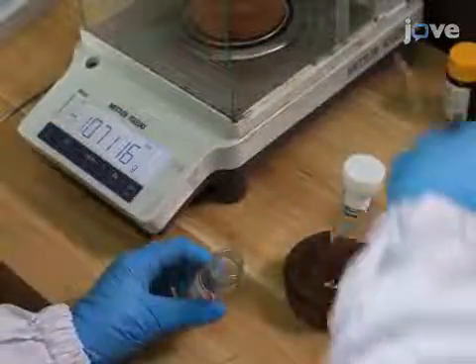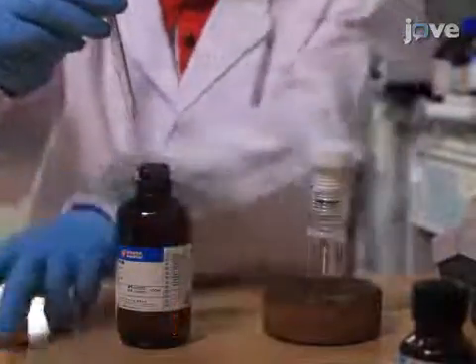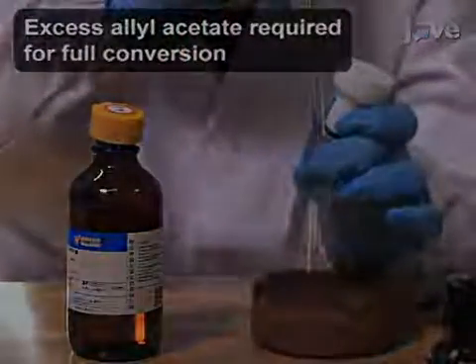Using the analytical balance, weigh 0.2 millimoles of acrylamide into the reaction vial. Then, add 43 microliters of allyl acetate to the reaction vial with a microsyringe.